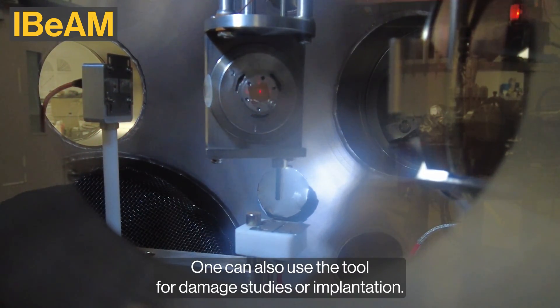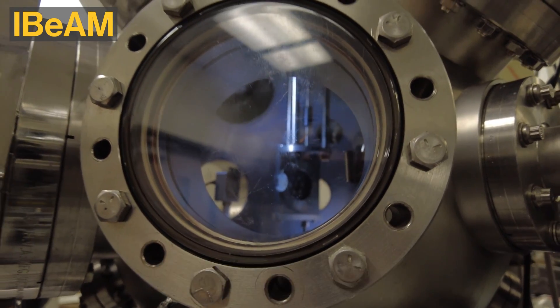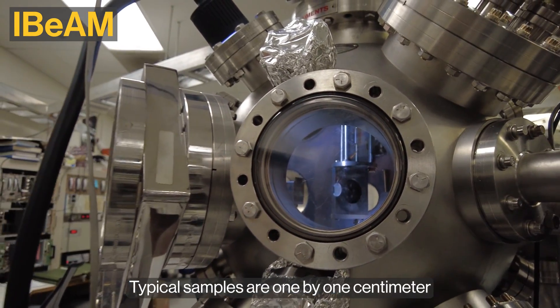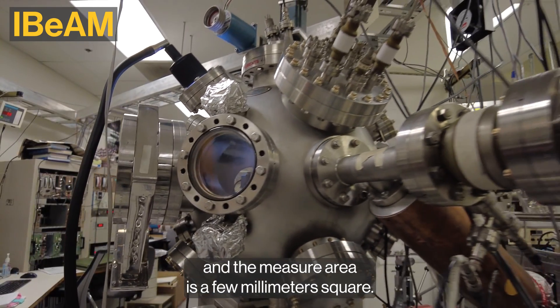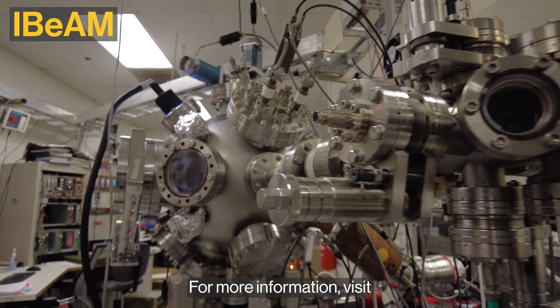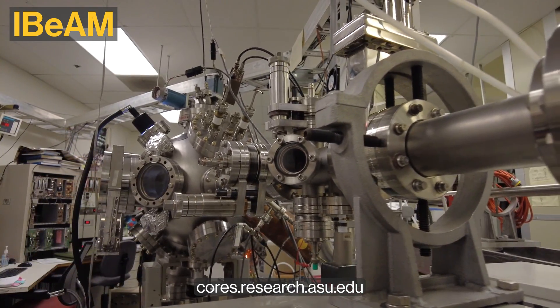One can also use the tool for damage studies or implantation. Typical samples are 1 by 1 cm and the measured area is a few millimeters square. For more information, visit cores.research.asu.edu.